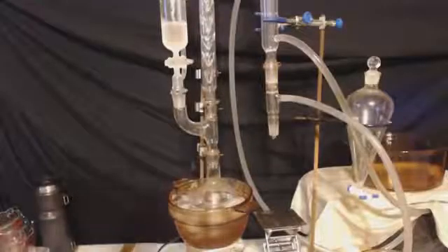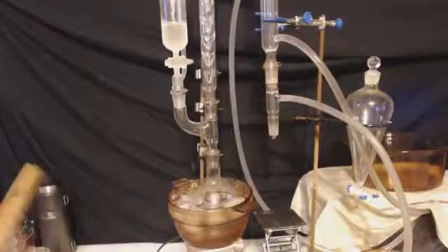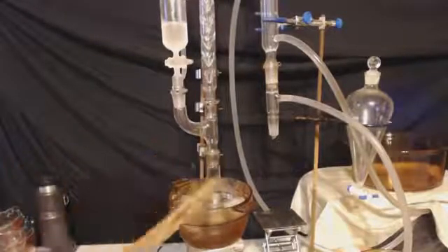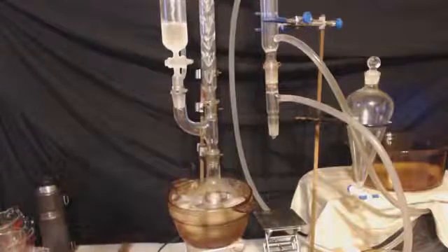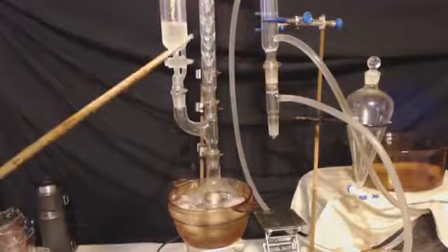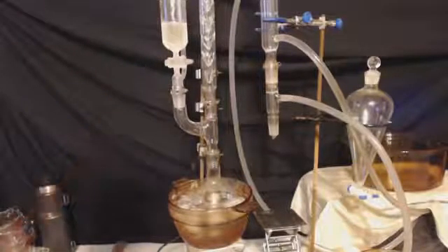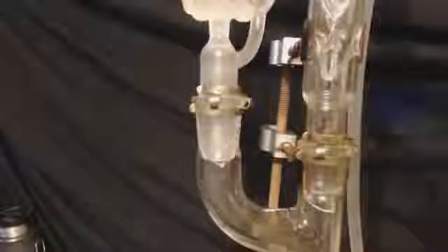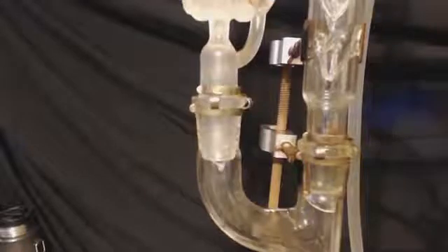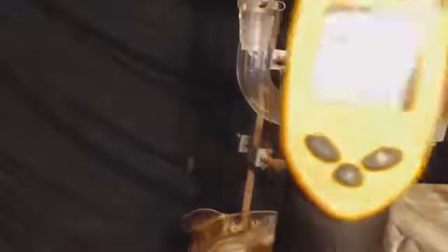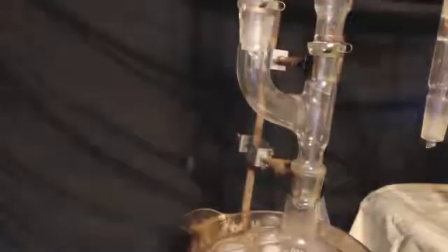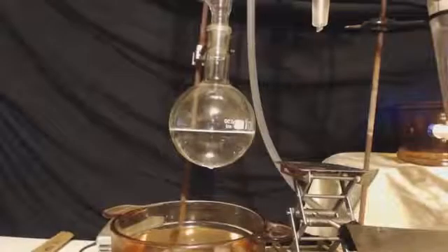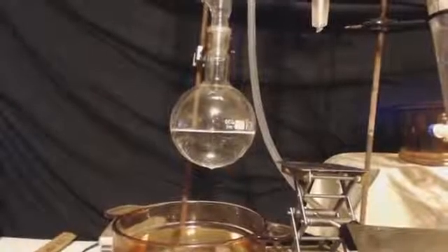We're here to make some ethyl bromide. Now you can see my apparatus. I have 146 milliliters of 80 proof, 40% vodka ethanol in the pot. Up here, I have some sulfuric acid, 66 milliliters concentrated. That's a mole and a quarter. I'll keep everything cold, keep it down, drip rate slow, and just basically drip that into there. I kept it under 15 degrees Celsius the entire time.